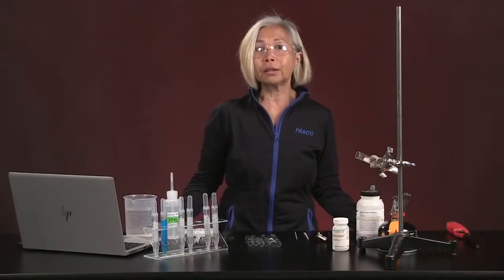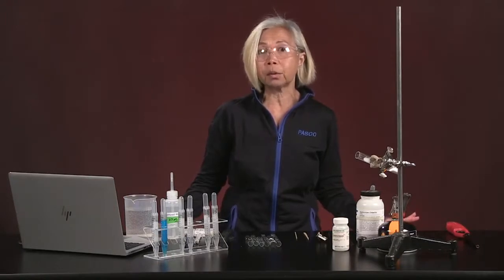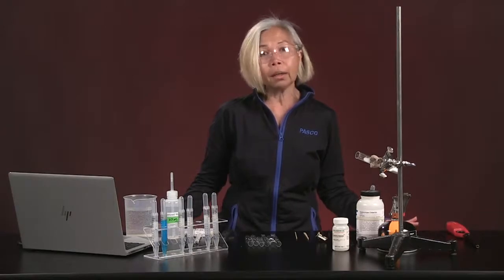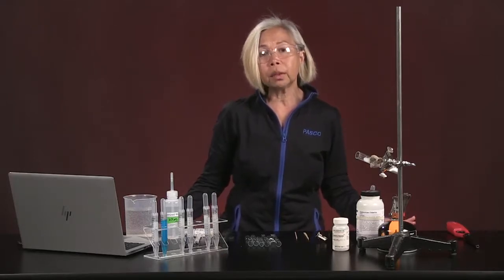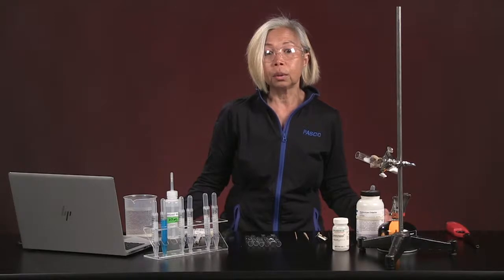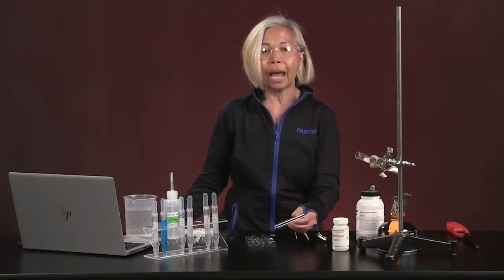For the qualitative section of this lab, we are going to be using our senses, and I will be telling you a few things if I observe anything interesting happening from my end. And you will be writing down all of the qualitative observations that you're making for each of the experiments we're running today. So we will go through these experiments as they appear in your worksheet from A to H, all right? So let's start with experiment A.